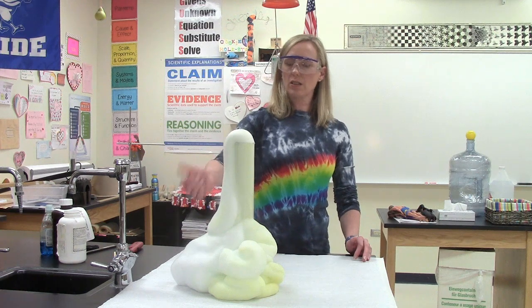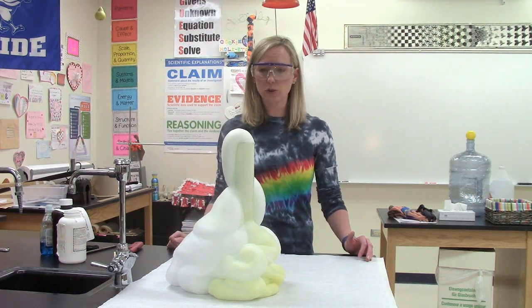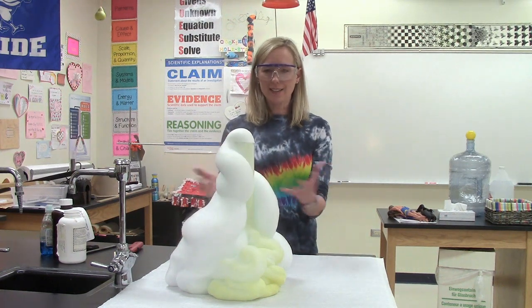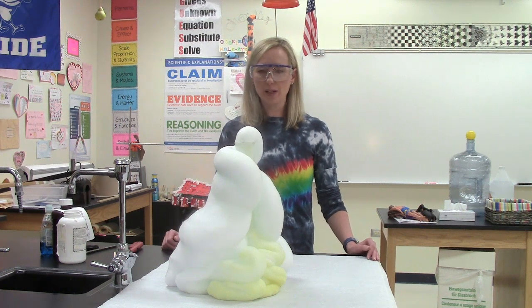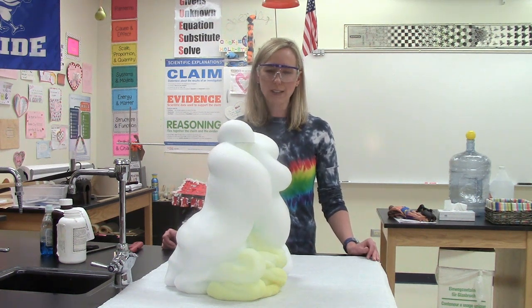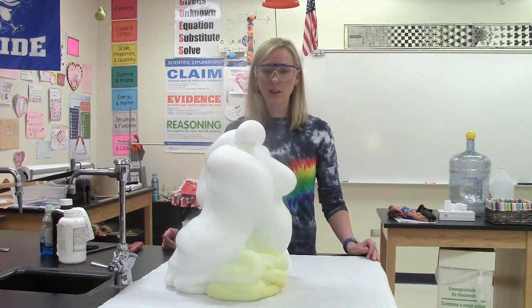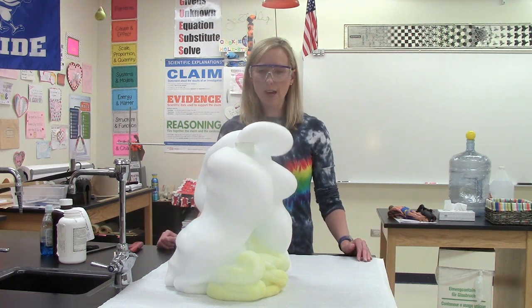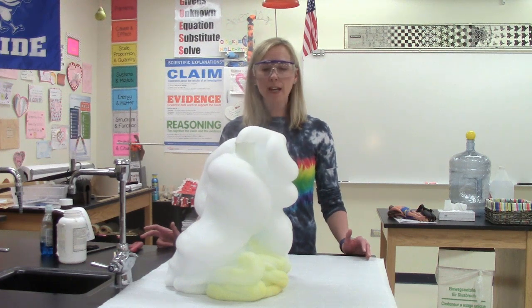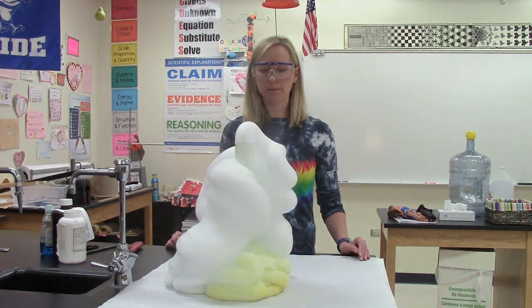So you'll see that there's a lot of steam being released, and some of the oxygen gas is getting trapped in the detergent. And so as that oxygen gets caught in the bubbles, we have this really cool effect that we think looks like the toothpaste you might use for an elephant, and it just keeps going and going and going. So really what we're making happen is the hydrogen peroxide is decomposing all at one time instead of very slowly over time, and that's the whole point of the catalyst.